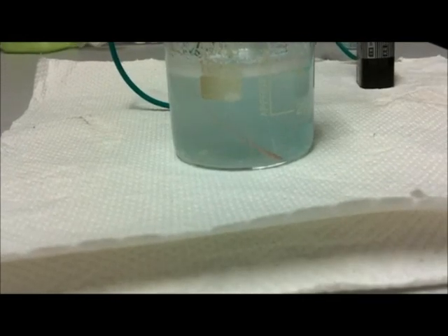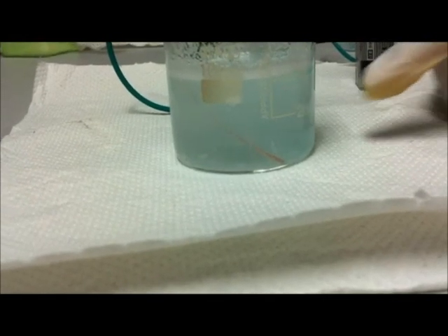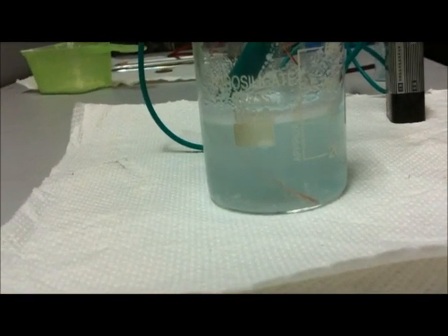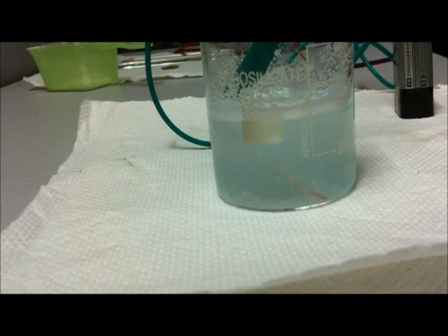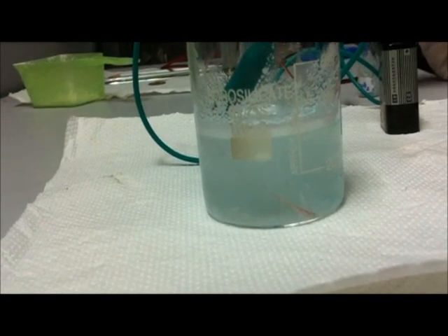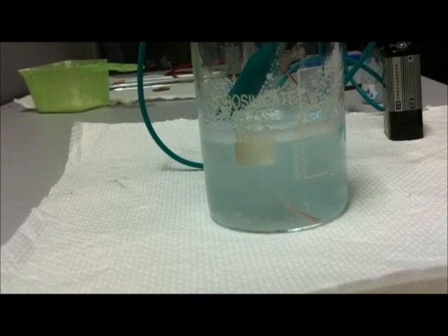Once in a while you should shake the electrode so that all the copper deposit falls off and so that the copper wire doesn't break away into the solution and contaminate it. So that's how you make copper hydroxide.